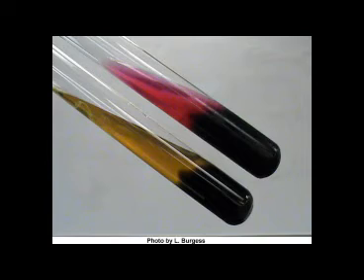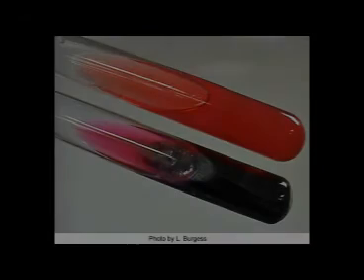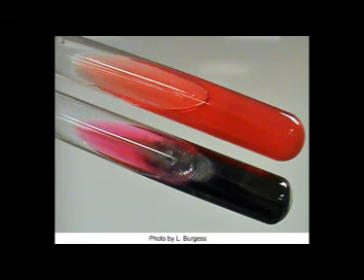Remember, if the organism is H2S positive, acidic conditions must have been present at some point in time in the tube in order for the thiosulfate to be reduced. Now shown is the alkaline acid H2S positive organism with a control.